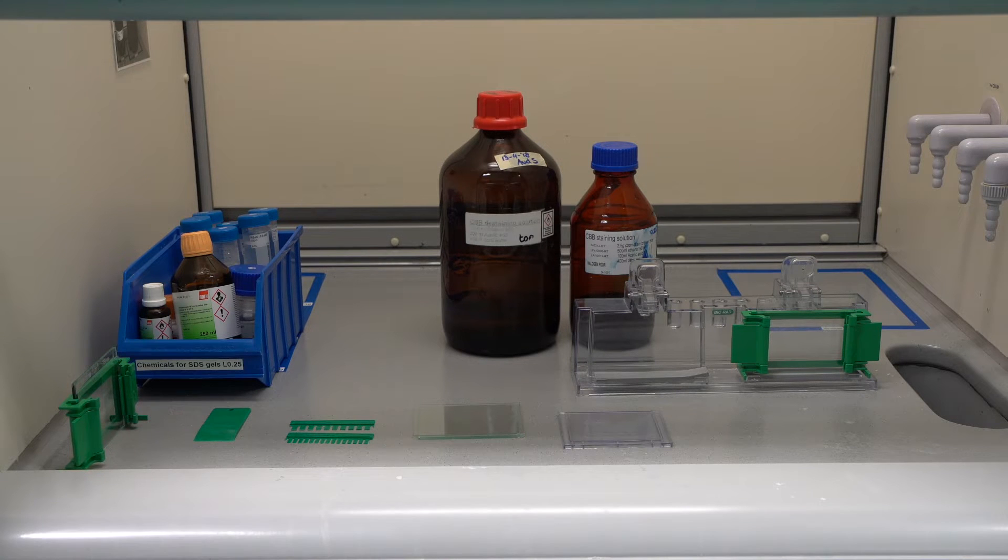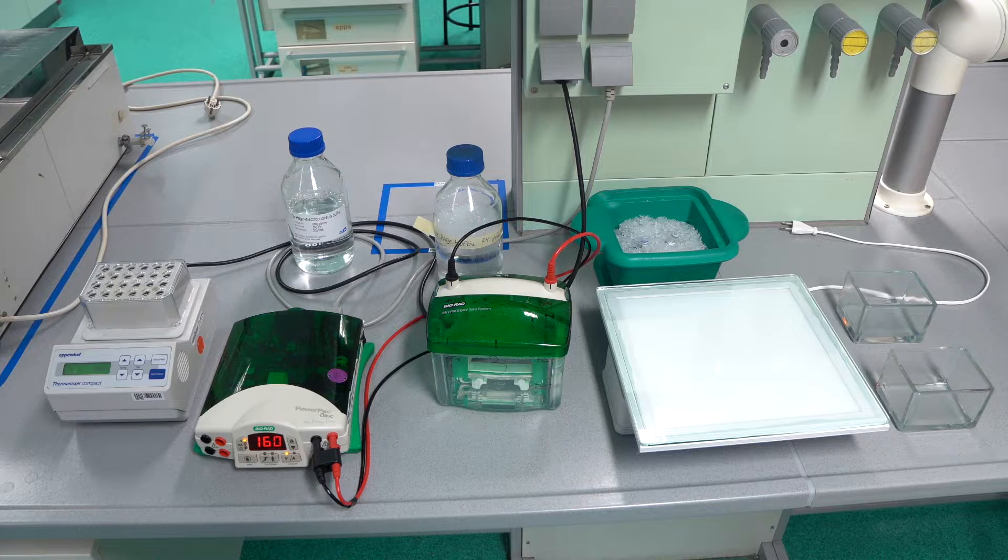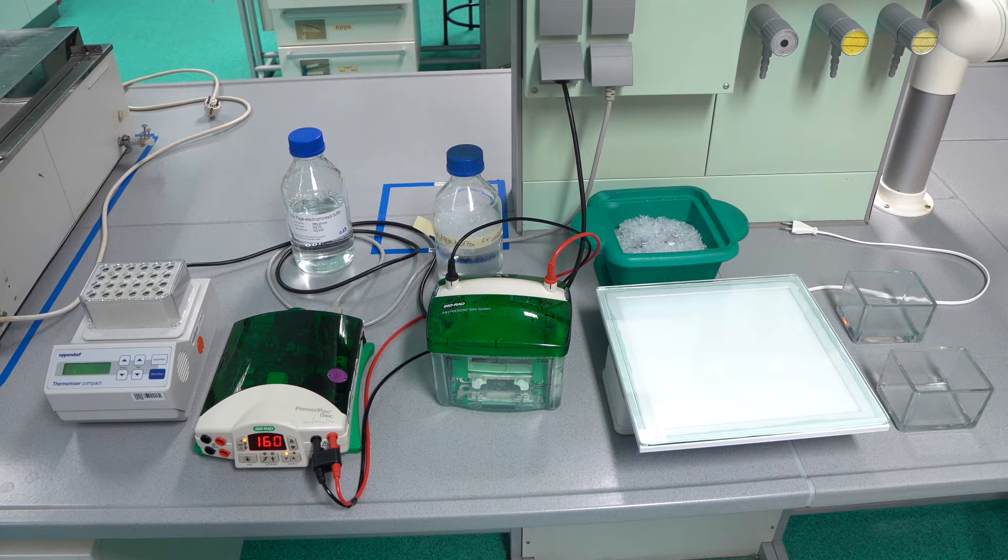Isopropanol, a buffer dam, 70% ethanol, filter paper, and a pipette aid. In addition, you will need a heating block, an SDS electrophoresis tank with power supply, one times page electrophoresis buffer, your samples, protein ladder, sample buffer, a light box, a centrifuge, a glass or plastic container, and a funnel with filters.